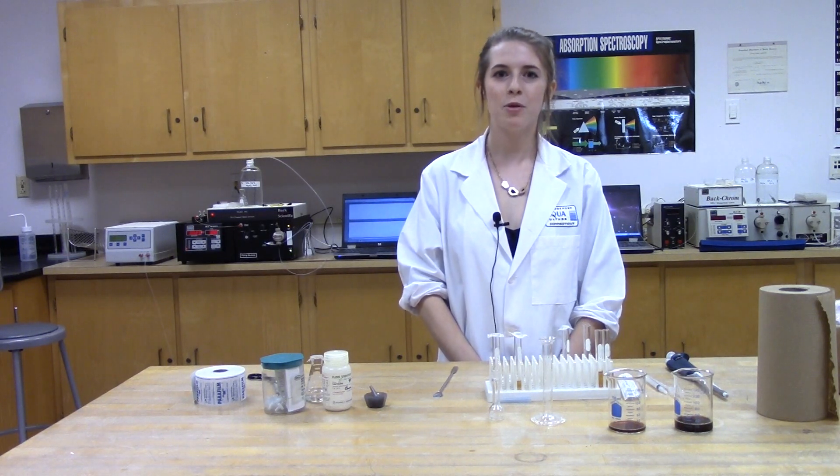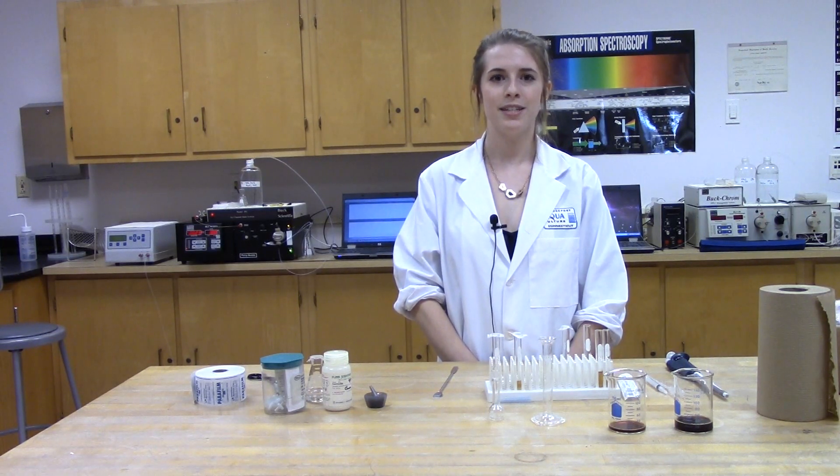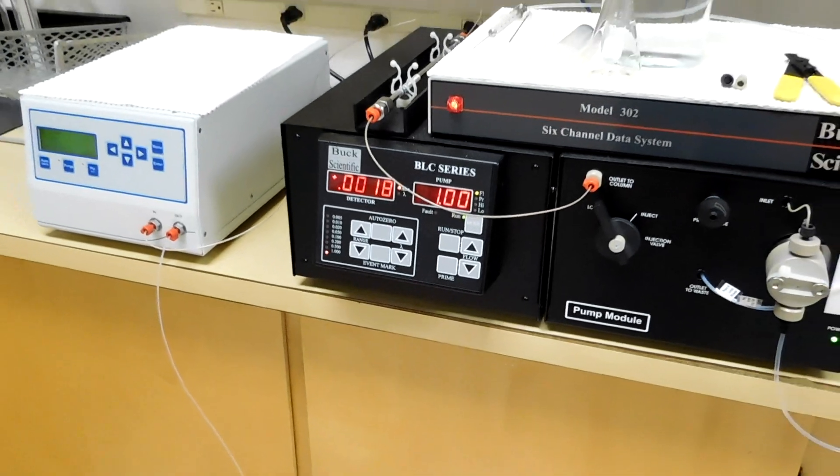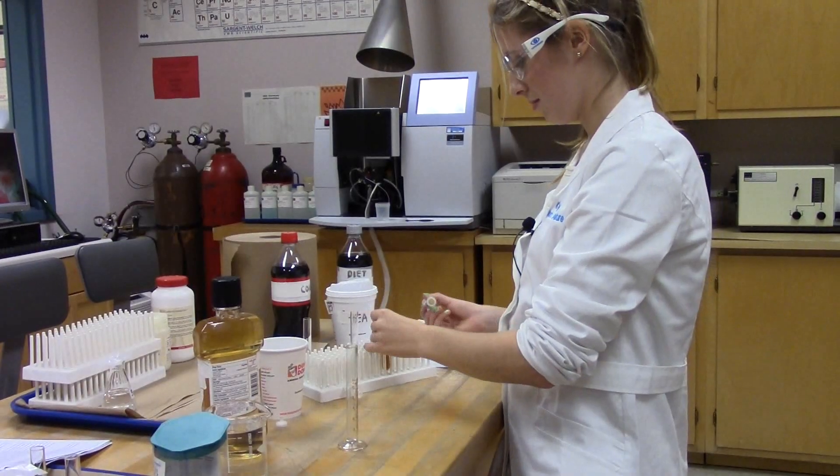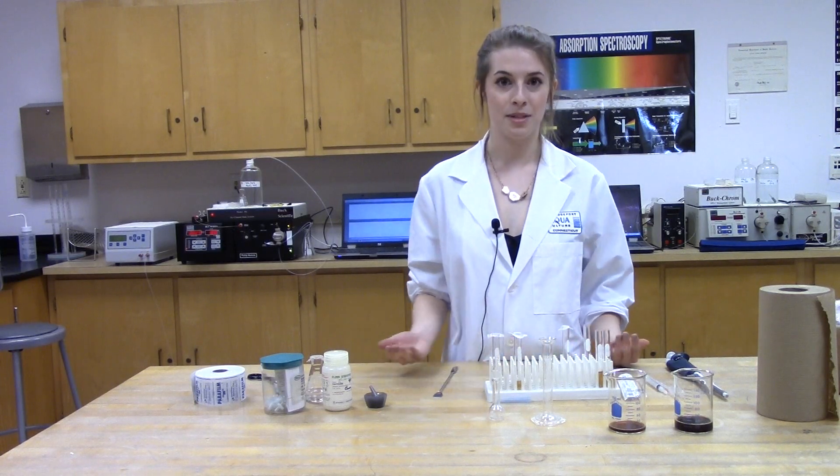So today we're going to be using the HPLC, sold by Buck Scientific, to identify the caffeine peak in coffee, tea, diet soda, and regular soda. So first and foremost, we're going to start with sample prep.